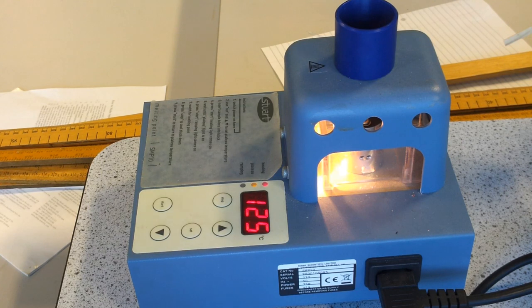This machine is going to check the purity of aspirin by checking the melting point. The melting point of true aspirin is 135 degrees, so let's see at what temperature our aspirin melts at to see if it is in fact pure aspirin.